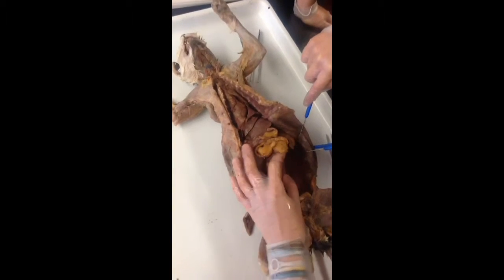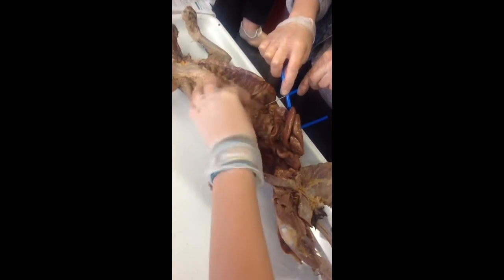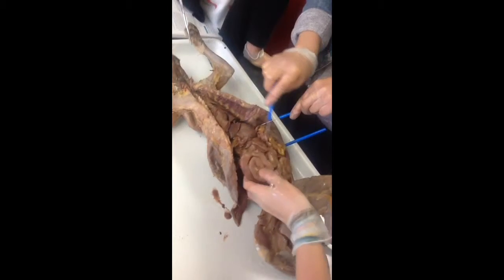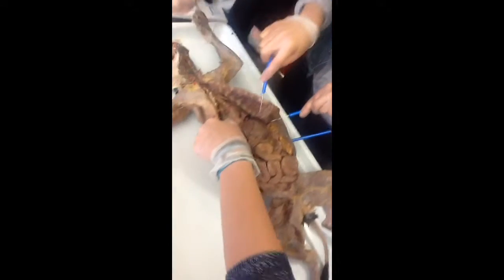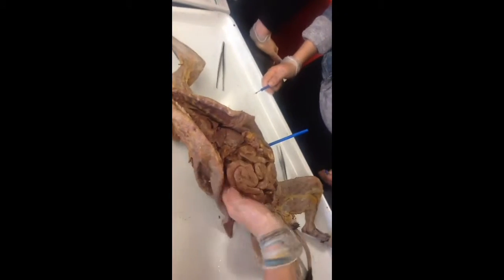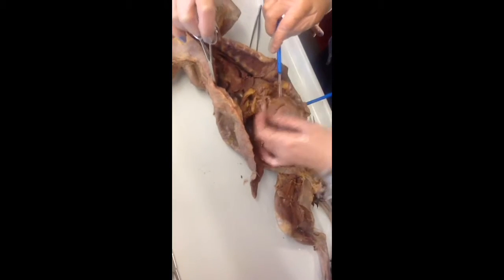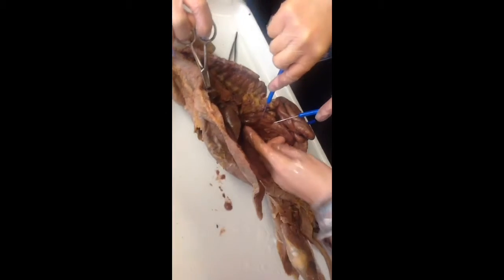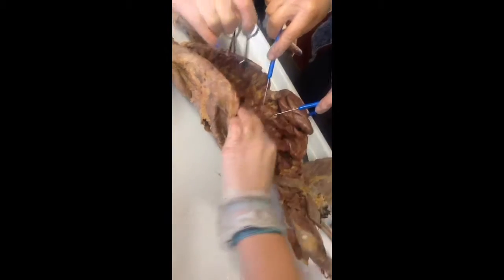Okay? So then, what else do you need to know? The pancreas. The pancreas is kind of hard to find, isn't it? It's on this side, and the way that I find it is I kind of lift up. It's going to be kind of on your small intestine. You're going to lift this up all the way back here. This is still part of your small intestine. And it's going to be this tissue up here. So see how that looks different than this?